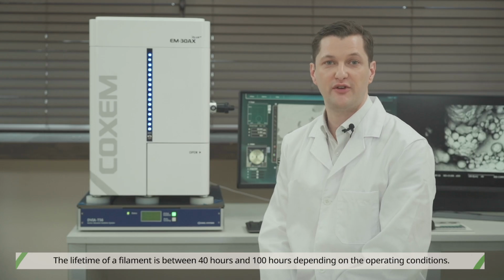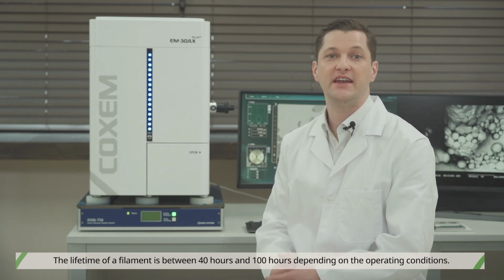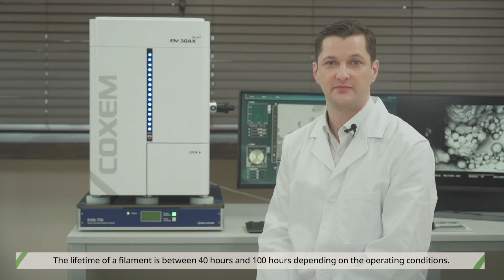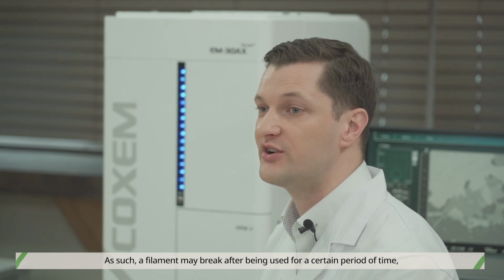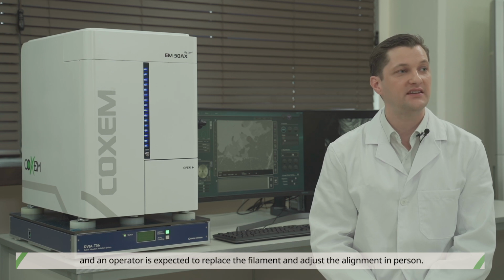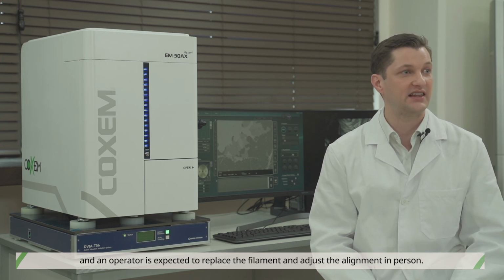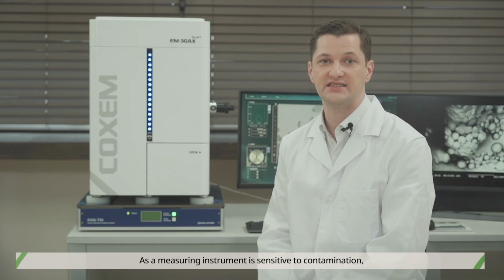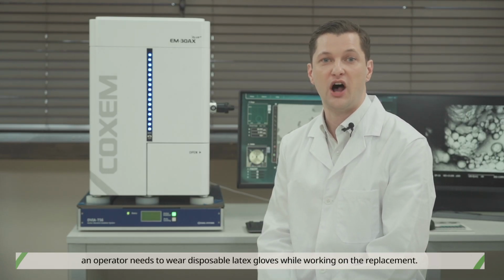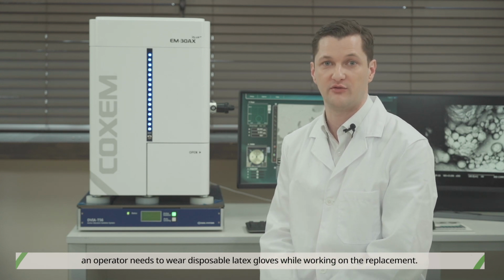The lifetime of a filament is between 40 hours and 100 hours, depending on the operating conditions. As such, a filament may break after being used for a certain period of time, and an operator is expected to replace the filament and adjust the alignment in person. As a measuring instrument is sensitive to contamination, an operator needs to wear disposable latex gloves while working on the replacement.